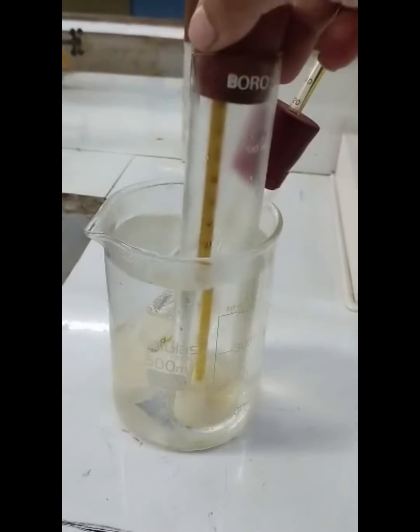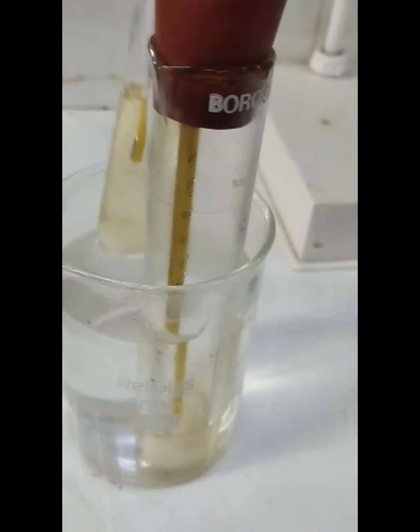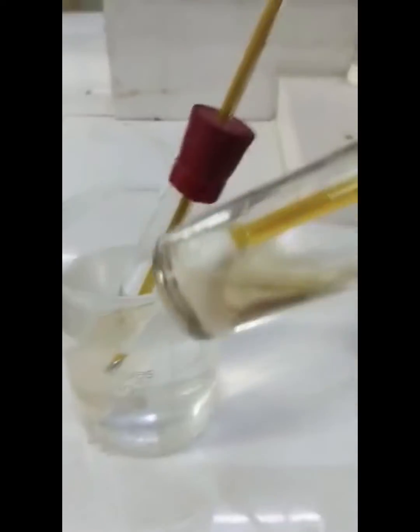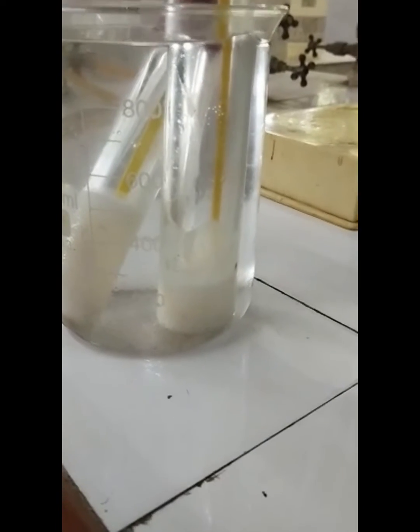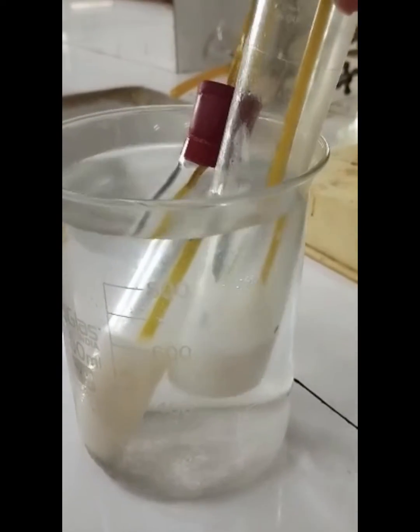The first time you observe cloudiness or haziness is known as the cloud point. You have taken the reading, but your aim is to find the pour point as well. If you see, this cloudiness will keep on intensifying, so you just have to keep it in the ice cold mixture as shown here and monitor the progress. With time, the paraffin wax will start precipitating, will intensify, and it will start to freeze.